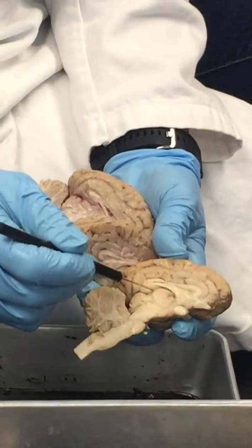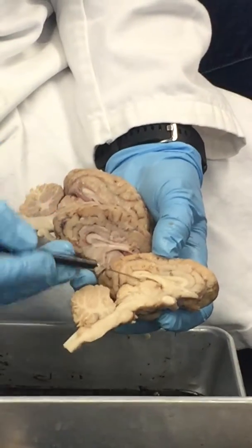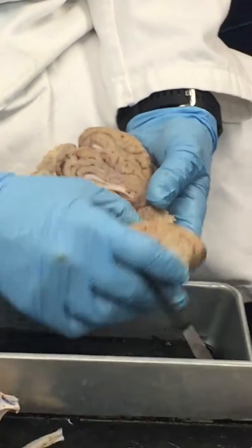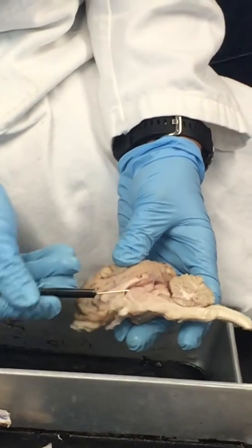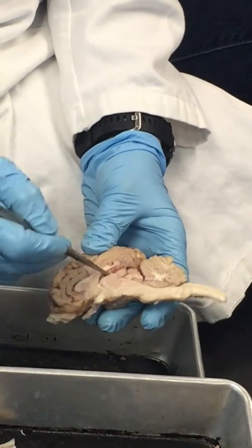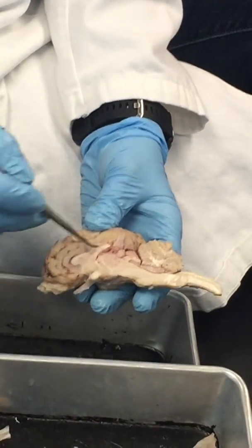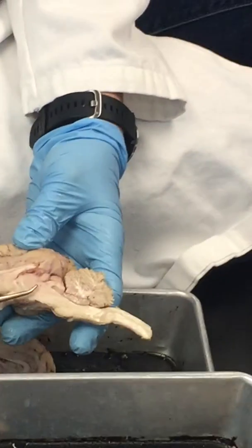Now the third ventricle surrounds it, right? So again, look, this is the third ventricle, this space here. There's more choroid plexus in there. You see that? All this choroid inside there. If I looked here, all this choroid. That's what I want. There we go. Now you can see all that choroid plexus inside there. Again, you have it in the lateral ventricles, you have it inside of the third ventricle.